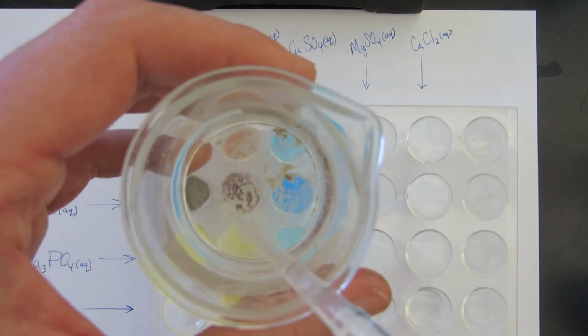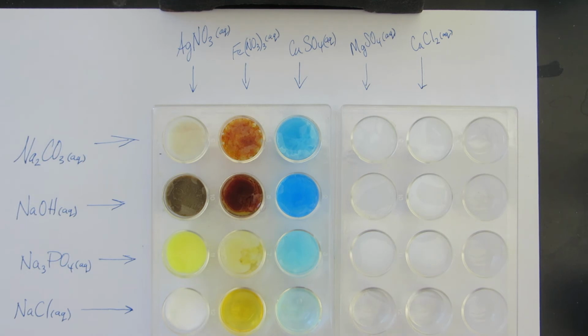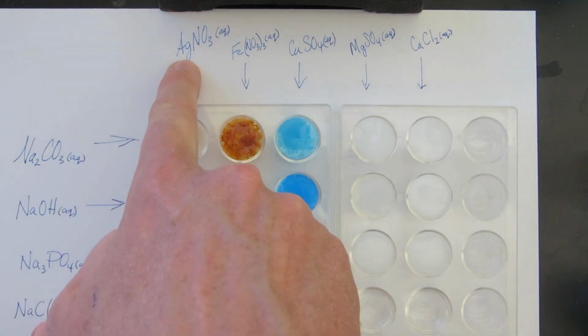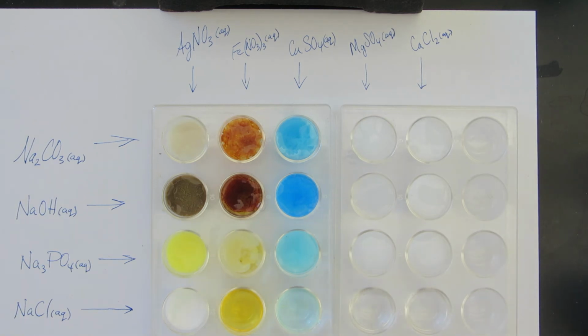And here's the sodium chloride. This was rock salt, so there's a little bit at the bottom. Maybe I could filter it, but not a big deal. Okay, so for that last row, the only precipitate that formed was this one here with the silver chloride, right? Silver chloride. So chlorides tend to be soluble. There are 3 common exceptions that we look at: silver, mercury, and lead. And so you can see the rest stayed as solutions.